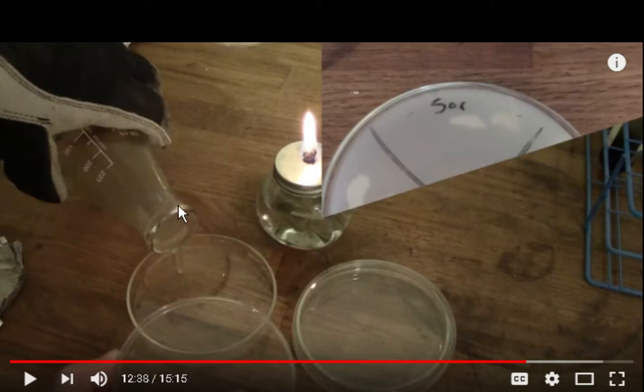I'm wondering about how long he waits. Now with me, I don't have agar, so what I'm going to attempt is to use gelatin, and I'm going to use a lesser amount of water with the gelatin to get it to become a little bit stiffer, more of an agar type mix, so that it's not so flubbery. That's what I'm going to be trying, and it'll be interesting.